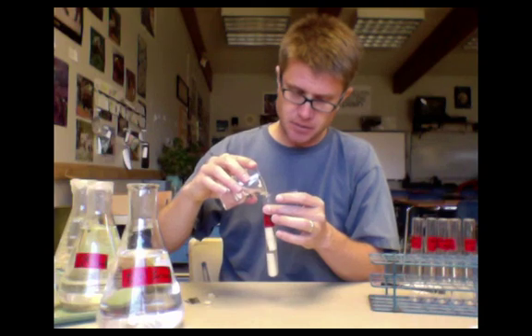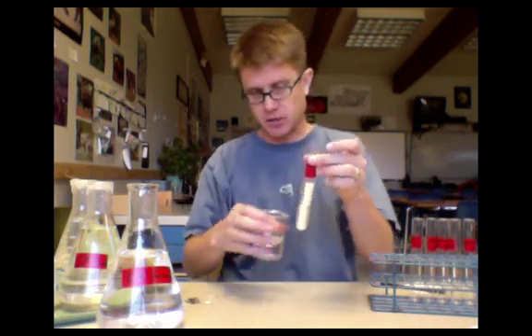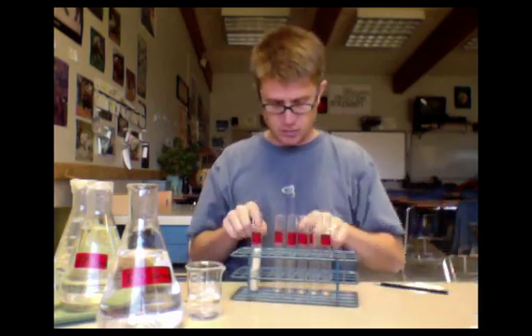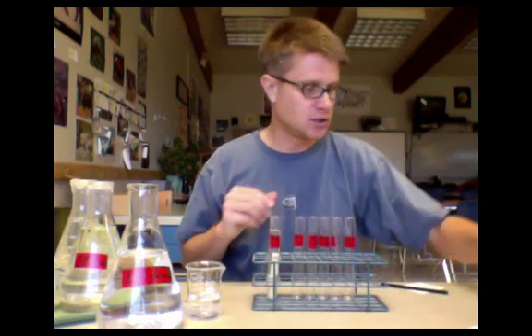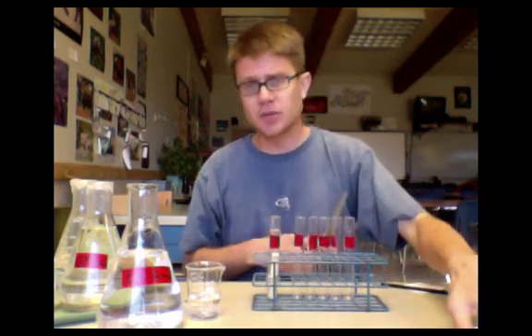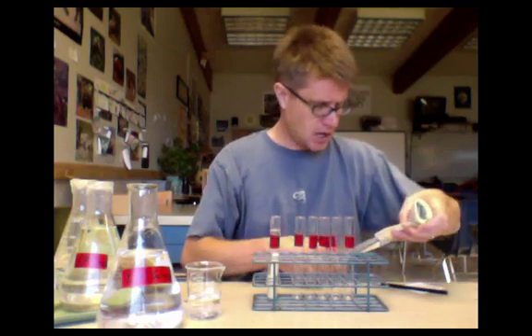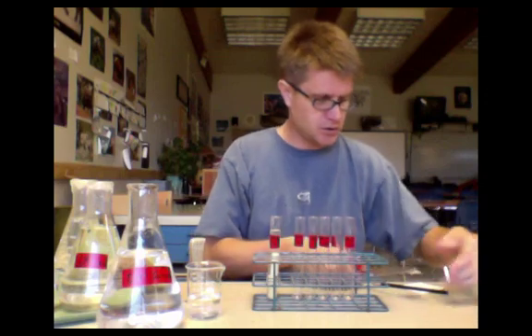You want to make sure as we fill these up that you cover the potatoes and that it's the same in each of these test tubes. We're going to have about the same volume in each of them to cover it up, because if we don't cover it up tonight there's going to be a lot of evaporation of the water.